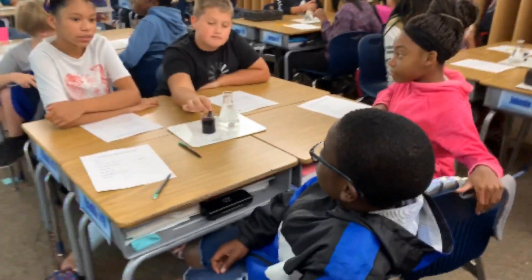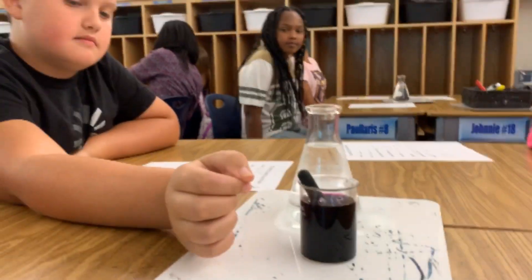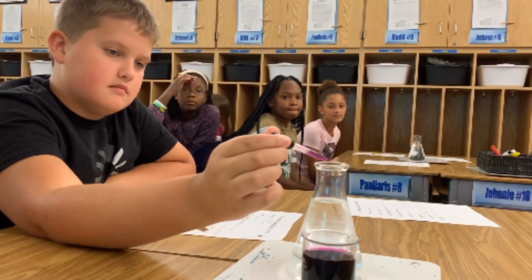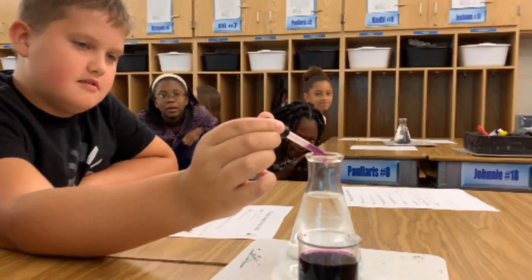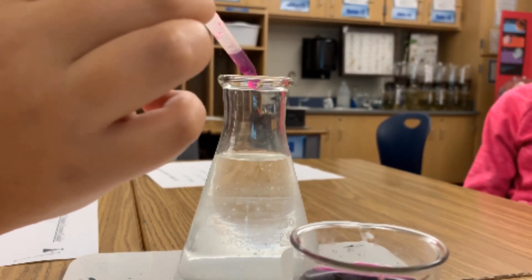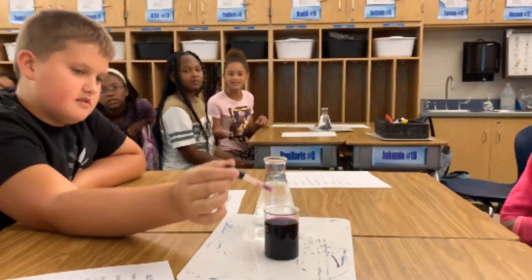There you see a little bit of fizz. The same mixture — potassium permanganate and hydrogen peroxide. Go ahead and add a few drops to it. See the color vanishes instantly — I mean it's gone the minute you add those drops. See how it's gone so quickly? That's great, Eli.